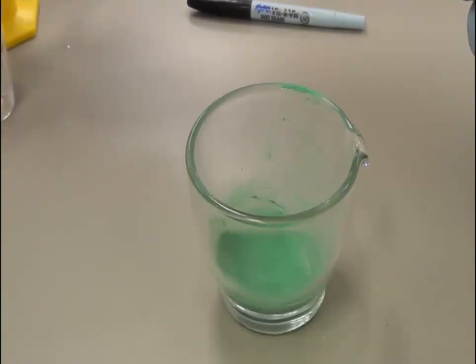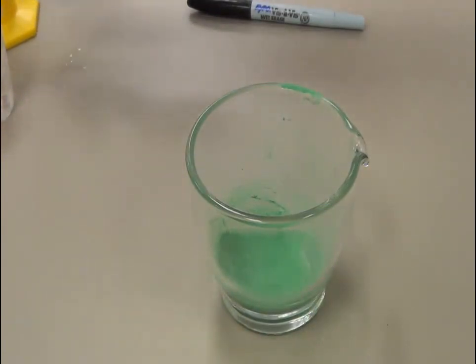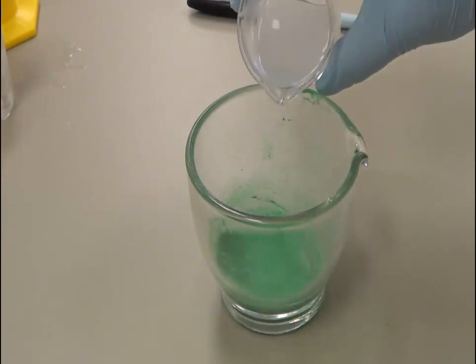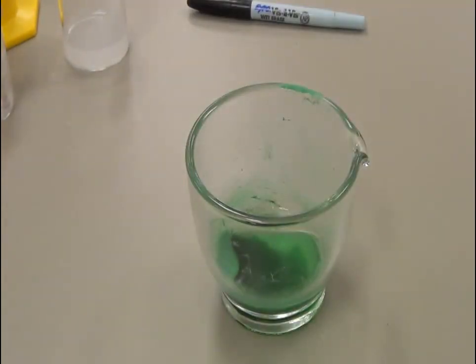The leftover drug is here. Today we are going to add a little bit more methyl cellulose — I am going to add 15 ml of methyl cellulose to this, approximately 15 ml.